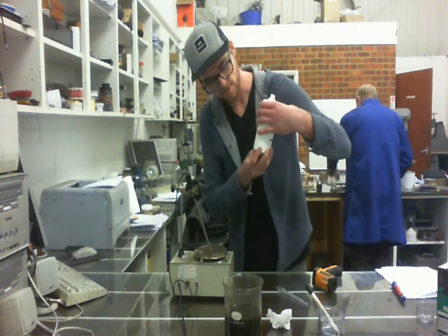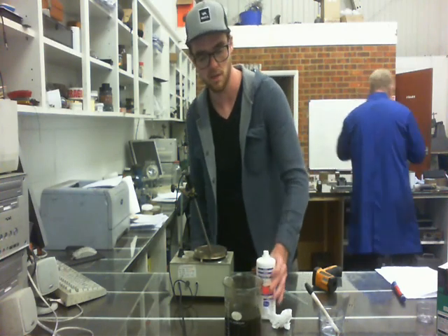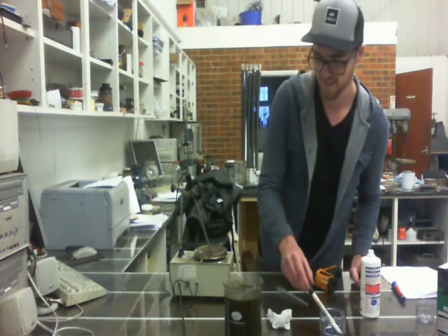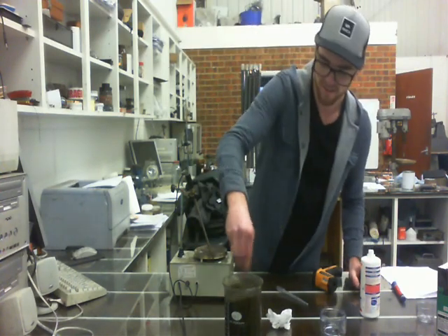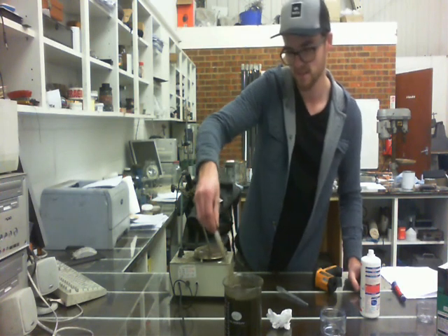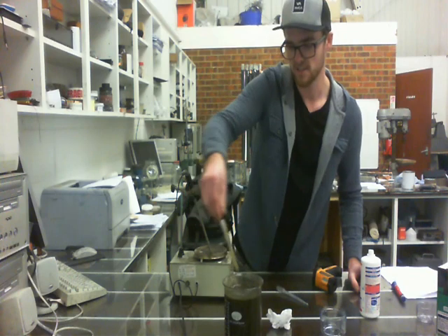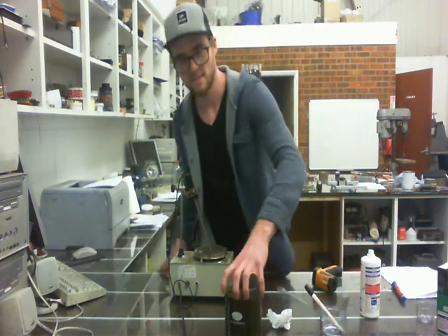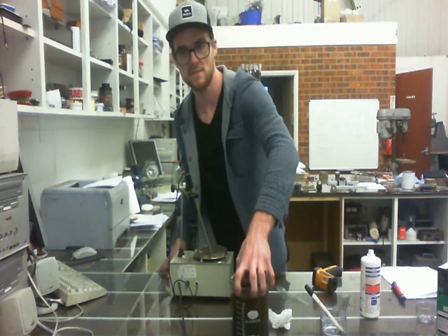Now all we're going to do is put this 3% peroxide in it. We've got about 360 milliliters here, and we're going to go ahead and put the whole bottle in. It's definitely a lot lighter in color than what it was before, and that's all there is to it. First time — so anybody can do it.